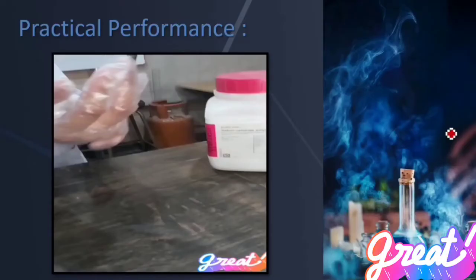So the most important and most rated thing is here, the practical performance video. Let's have a quick glance at how to make a solution. This video is very helpful for making a solution.